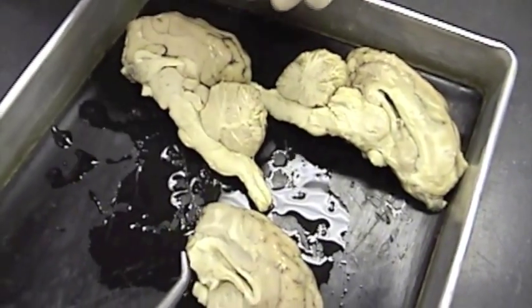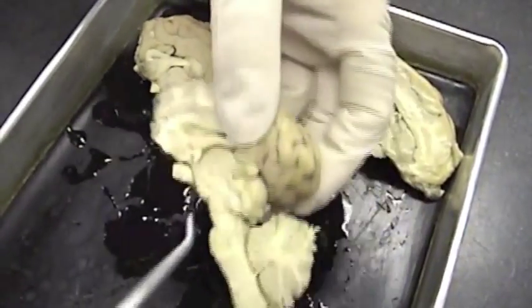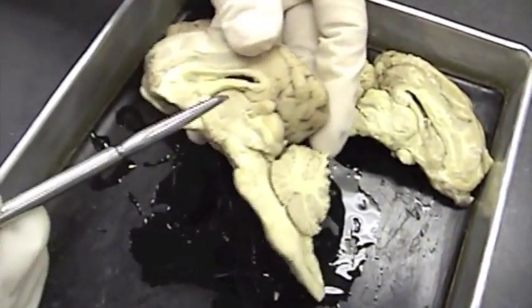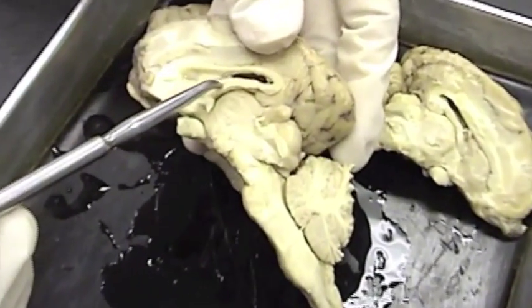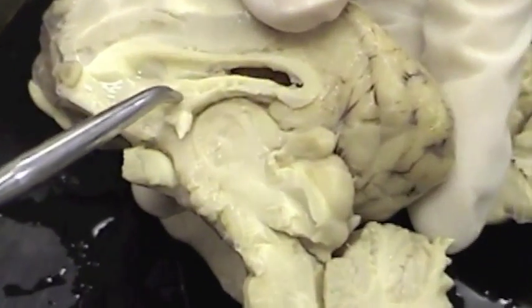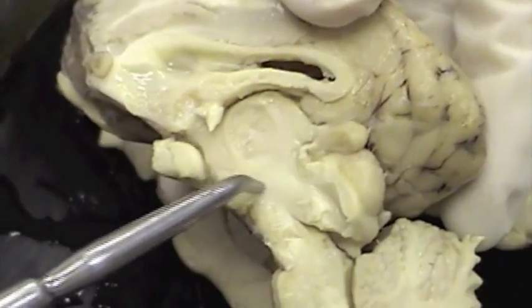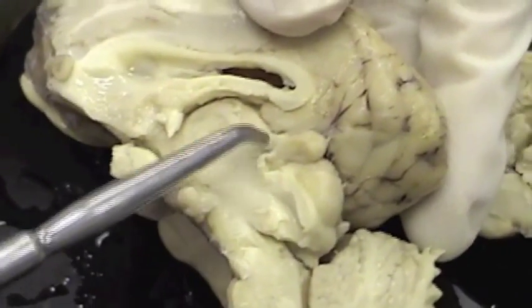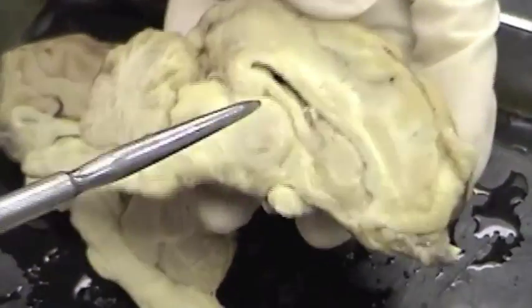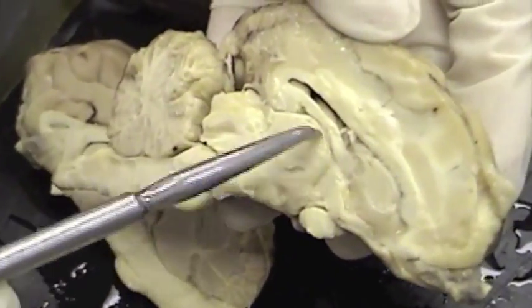Next we have the thalamus. The thalamus is seen pretty well on this brain. It is directly inferior to the fornix — here is the thalamus, this round structure right here. Here is the thalamus on this brain as well — a nice round structure.